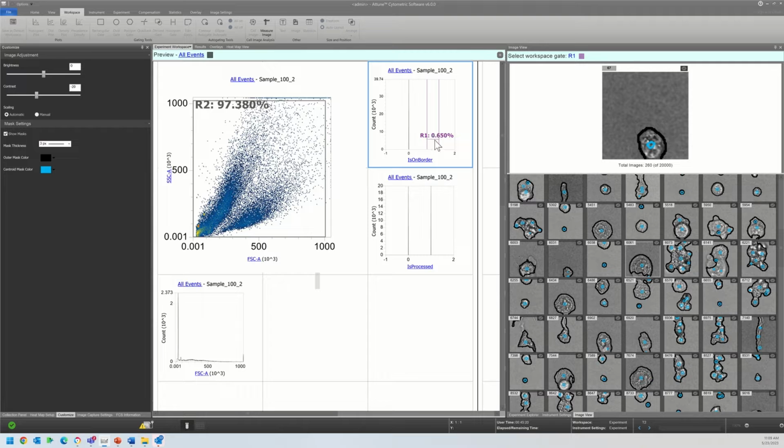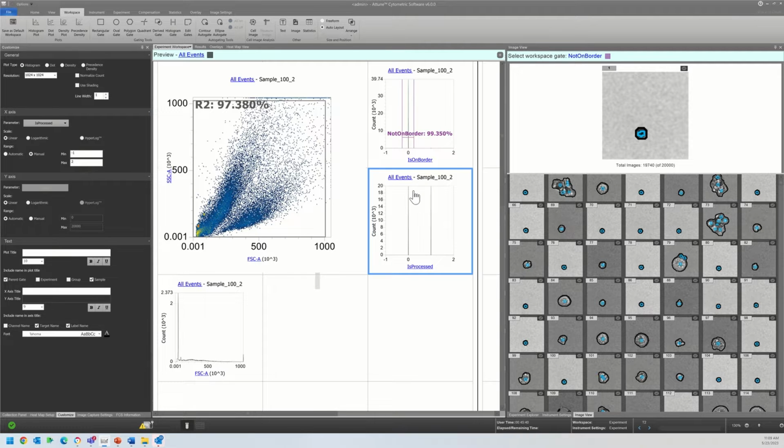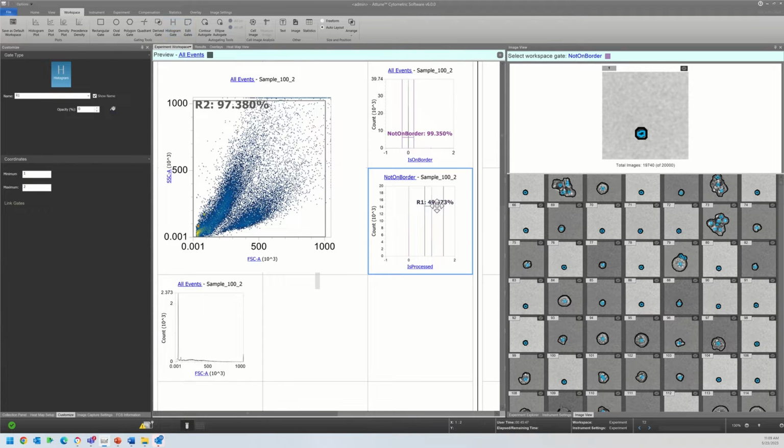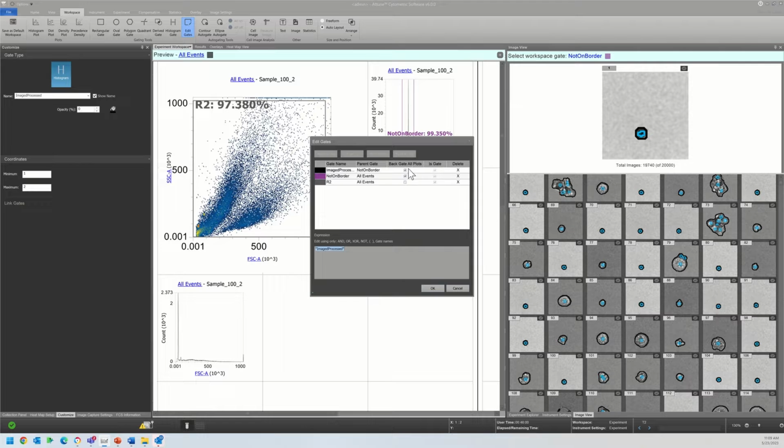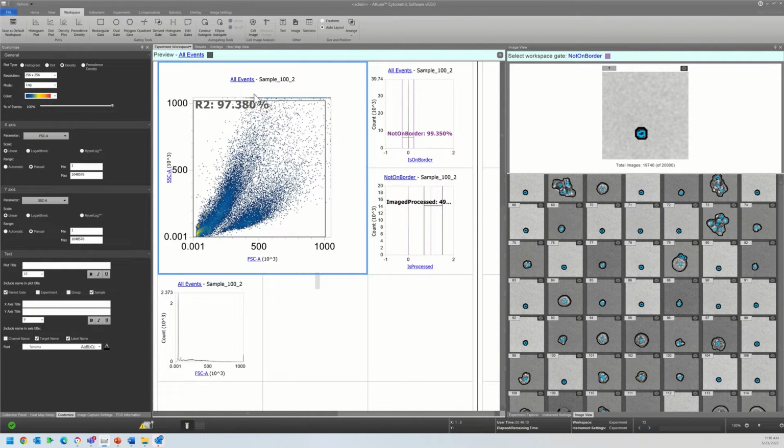And if I come over here, these are not on the border. So we are going to go ahead and use these. So not on border. And then down here, that will be our new parent gate. So not on border. And we are going to say is processed, yes. Say imaged and processed. And set this to black. Up here in edit gates, I can also turn off all back gating if I want and delete a gate that I accidentally set incorrectly. So now imaged and processed is going to be our parent gate.